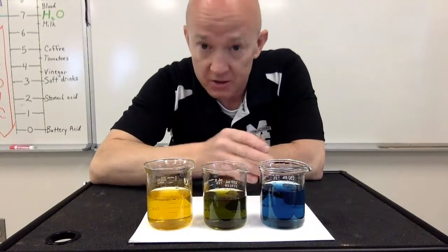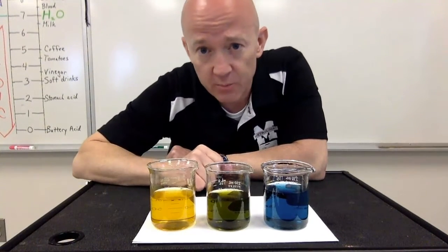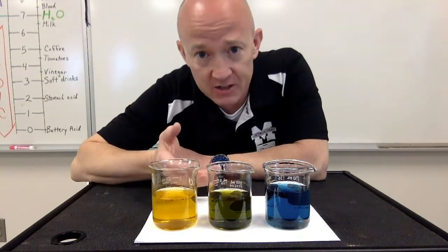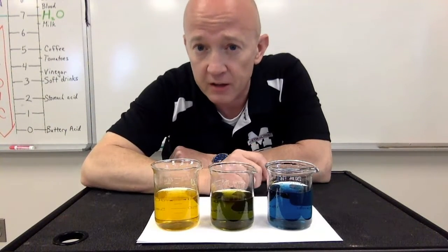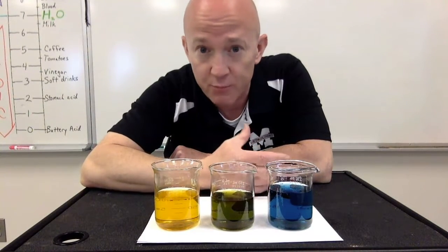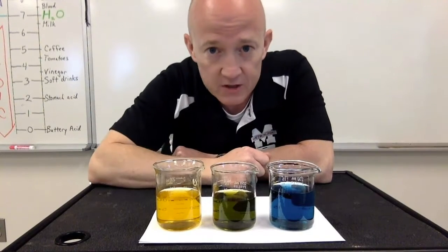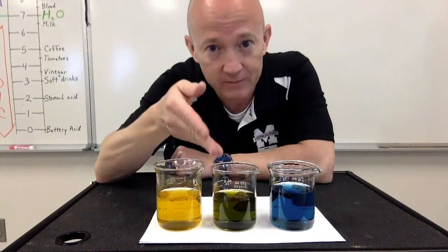These 3 beakers contain distilled water and the same indicator in each one. That indicator is called bromothymol blue. Now remember, we said that indicators are compounds that will change color depending on what situation they're in. If they're in an acid solution, they'll change to one color, or if they're in a basic solution, it'll be another. We used an indicator called phenolphthalein in our previous titration in the last video, and phenolphthalein in a basic environment gives us that pretty pink color that we saw. Bromothymol blue gives us a yellow color when it's in an acid solution, and a blue color when it's in a basic solution. And when it's in a solution that's neutral, you guessed it, yellow and blue make green.